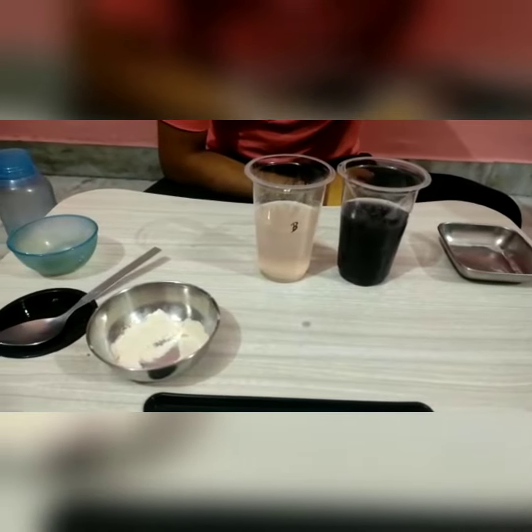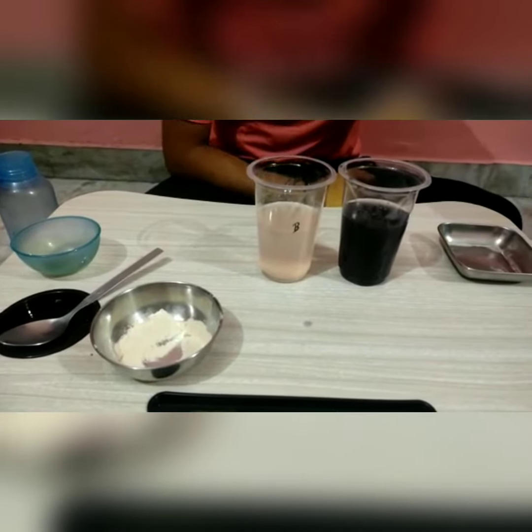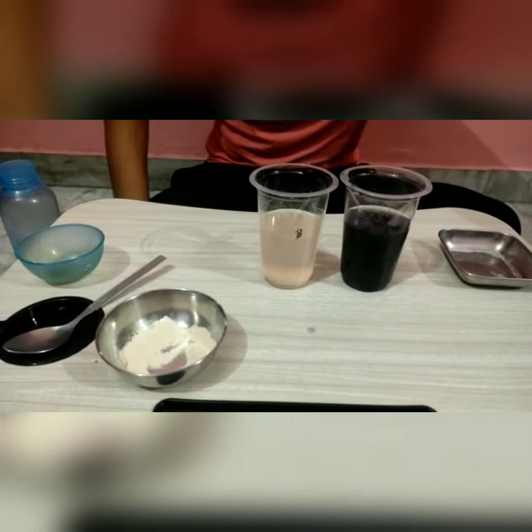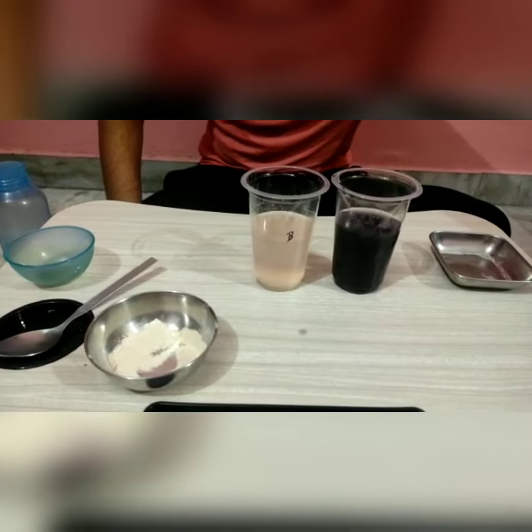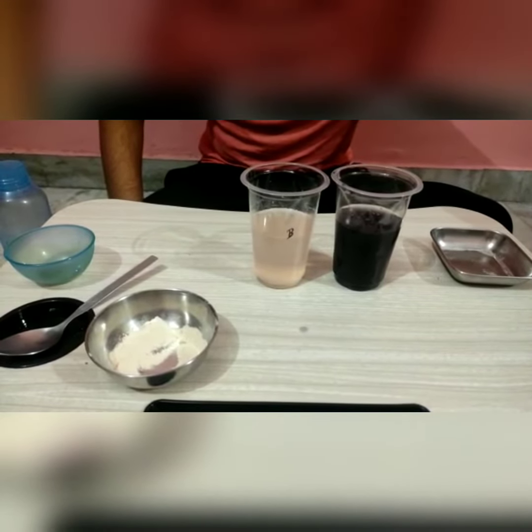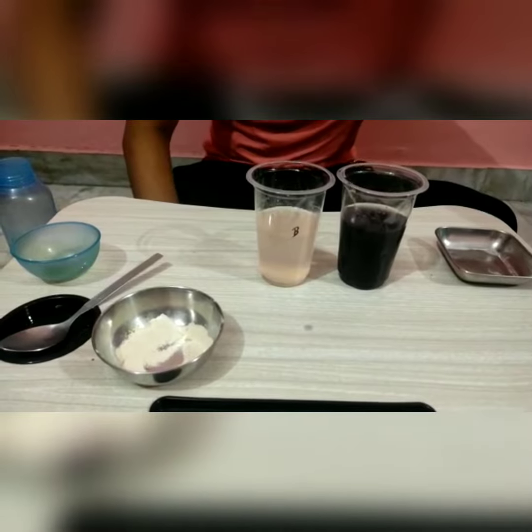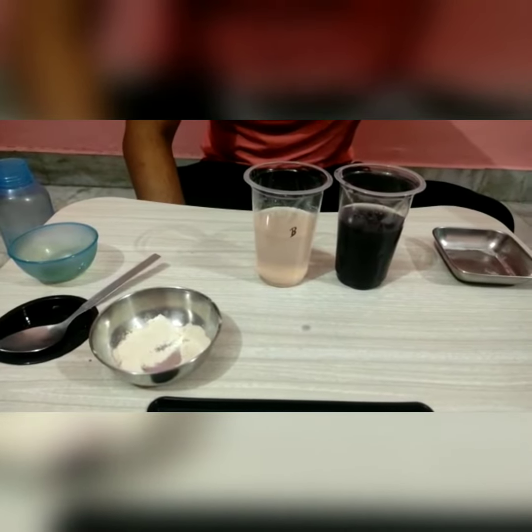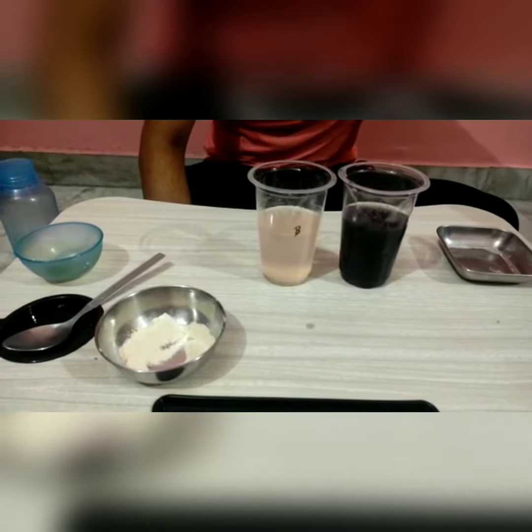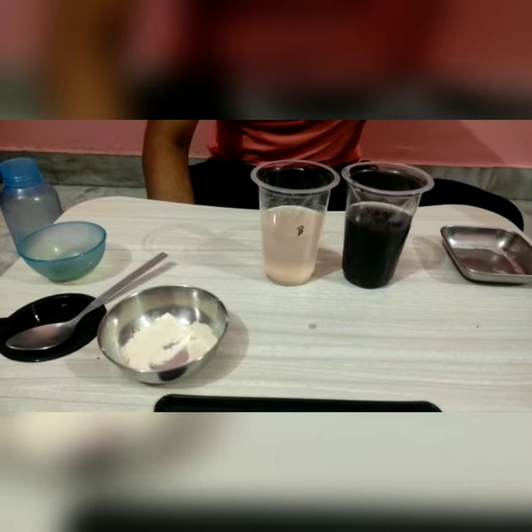As we see in the glasses, there is a huge difference in both the solutions. Glass A shows the blue-black color but glass B doesn't show the blue-black color. This is because solution A has starch, and starch is a carbohydrate which gives blue-black color when iodine is added to it.